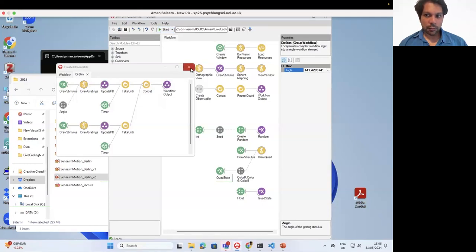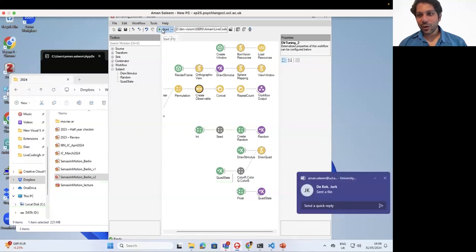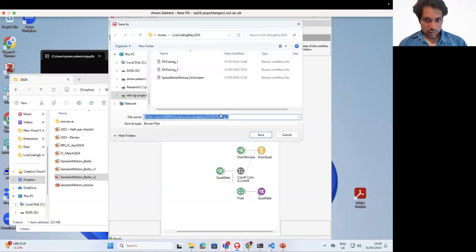Now, there are some other strategies which we might use, let's say we wanted to go on and off depending on whether the stimulus was, let's say we're presenting a movie, or let's say we're presenting, so I'm going to save this as a PD.